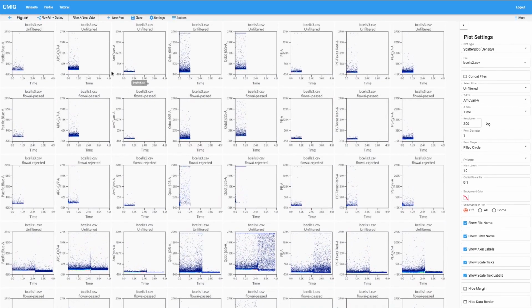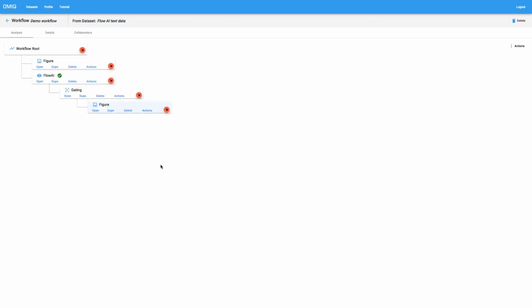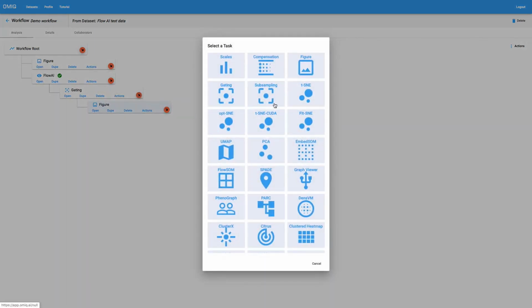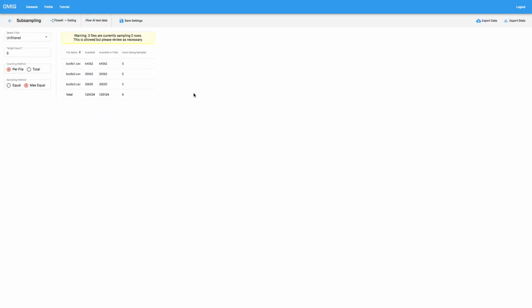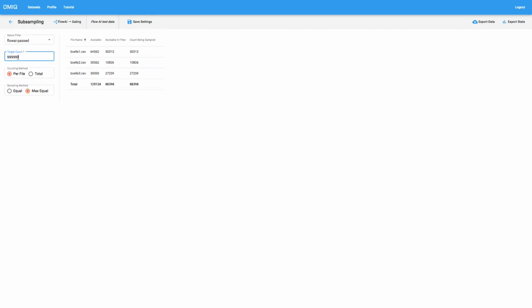After this, we can decide what we want to do next in our workflow. And the way that we'll do that is simply by going to gating and then making sure that we choose the subsampling task. Now, the subsampling task actually allows us to subsample our data according to some sort of filter. And so this step is crucial for actually deciding that we want to accept these flowai-passed events and actually take them forward in the analysis. So we can go ahead and max out those and change our sampling however we want. But now you can see that we are in fact subsampling these data.